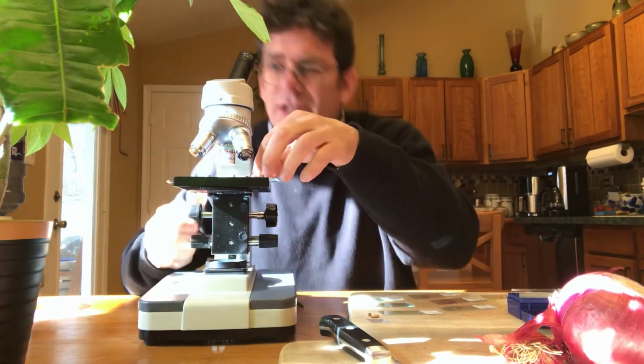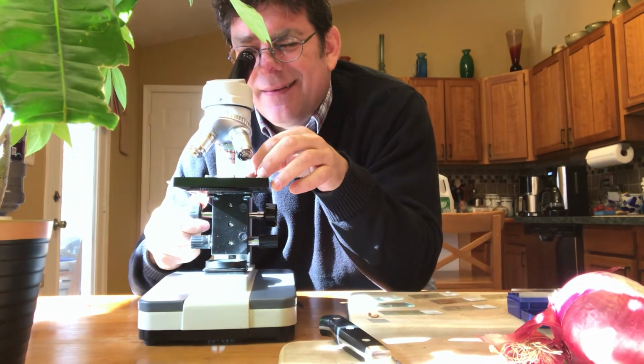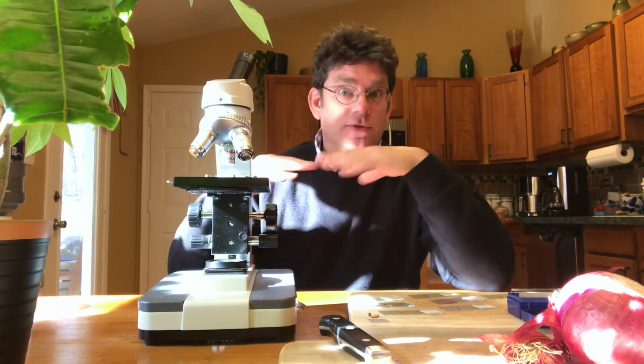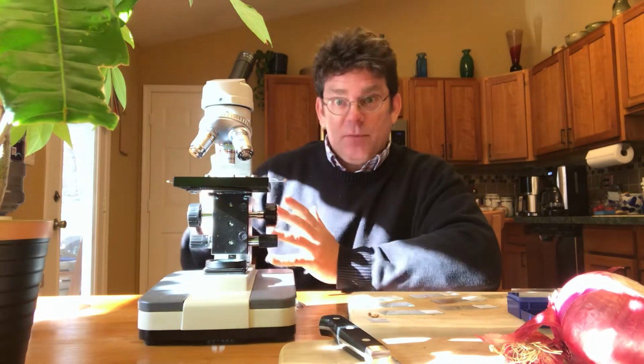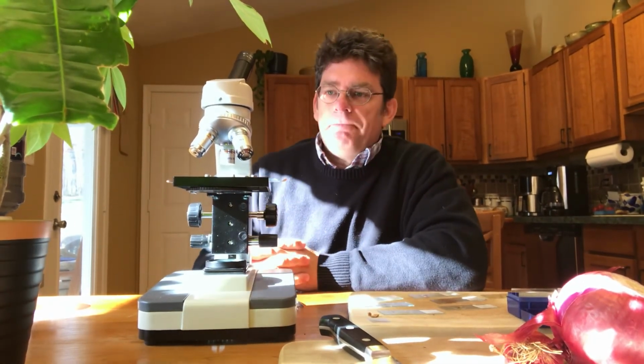And let me see if I've got any cheek cells in there. Yeah, there they are. I can see them. Yeah, they look like little round circles. So again, I'll do my best to try to photograph that to show you. Really, if I don't stain them, cheek cells are going to be translucent. They're really clear. They're hard to see. But if you put a drop of dye or stain on them, then they'll show up and you can actually see them, and you usually see the nucleus.